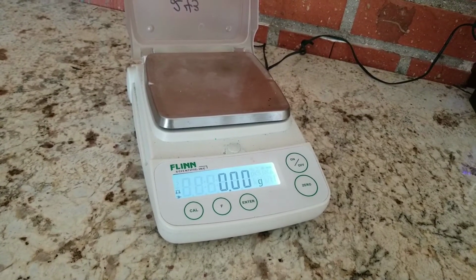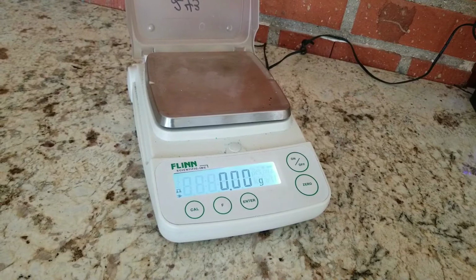For this activity, we're going to be doing a combustion reaction just using a tea candle. And the goal is for us to record the mass over a span of time. The one thing that we need to do for this activity is create a table of time versus mass in grams.